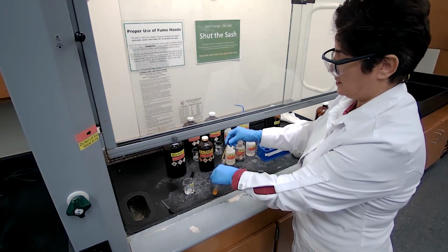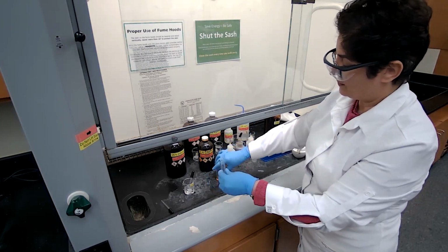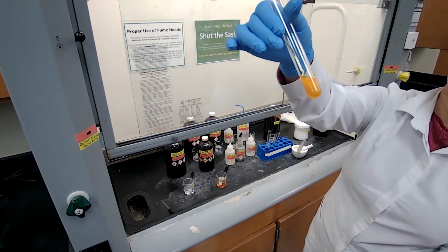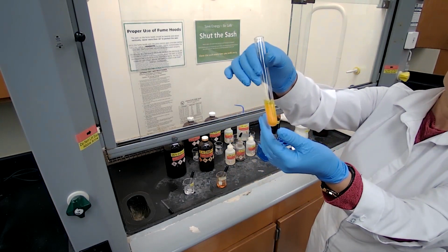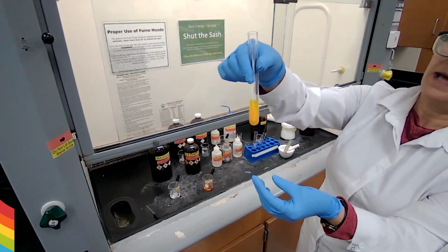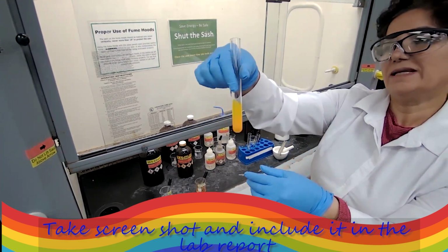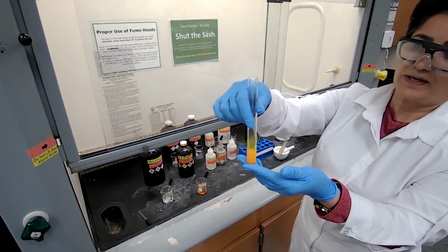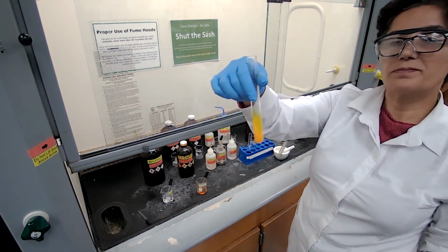I'm adding 3 full droppers of the 2,4-dinitro reagent. The precipitate has formed. It's cloudy, definitely cloudy. And this formation of precipitate indicates that the sample of the unknown is either aldehyde or ketone.